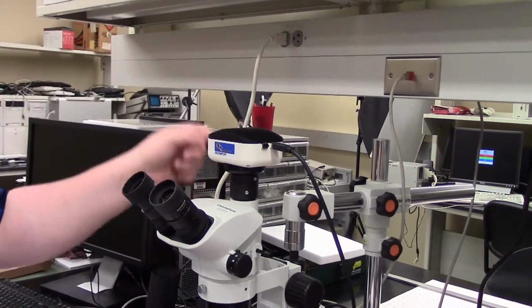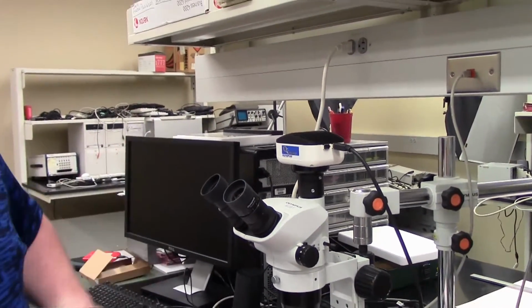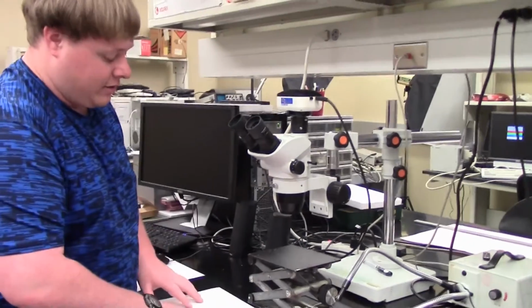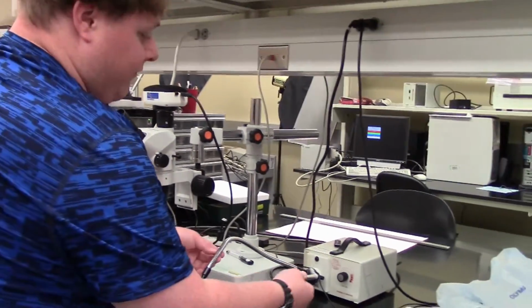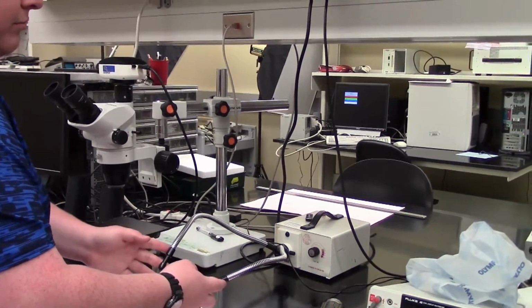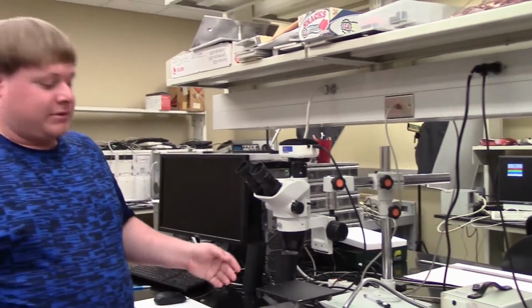This will connect directly, as you can see, to the computer, and also we have our stand. This is our moving stand, or motion stand. In addition, we have a fiber optic gooseneck power source. This will provide the light source that we need for the microscope because it requires a light source.